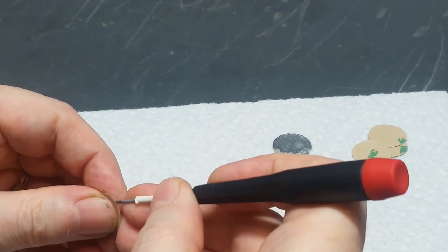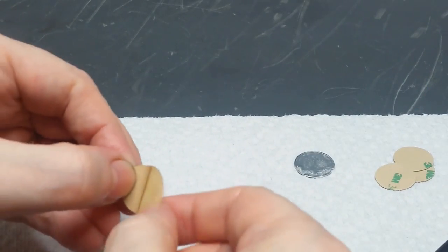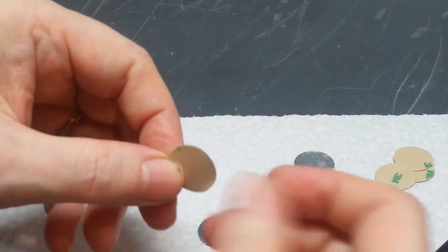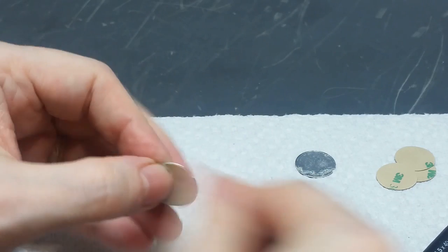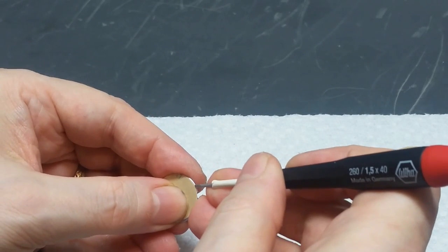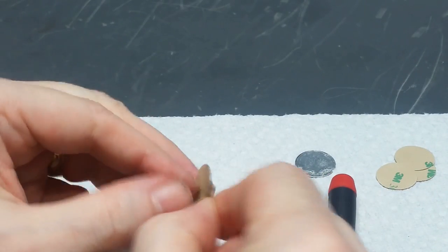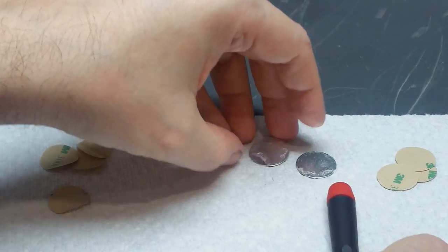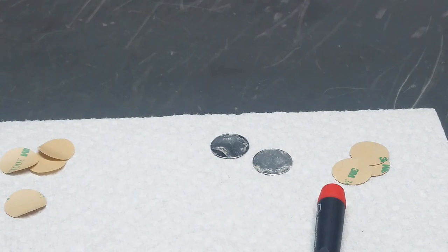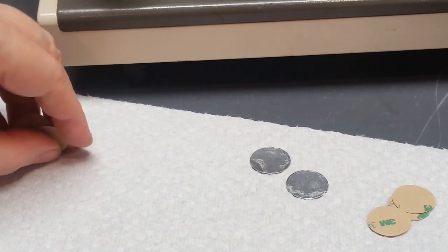Now I'd like to do the same thing for this one. Okay, that's the protective liner. Press firmly onto the knob cap and remove the other liner. Okay, so these are ready to go back on the scope. I just want to be careful and don't get any contaminants or dirt or finger oil on them. Otherwise, they may not stick very well. Okay, let's do it. Let's get these knob caps back on there and call this thing done.